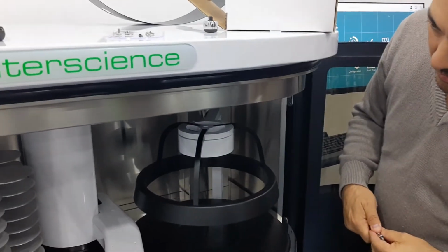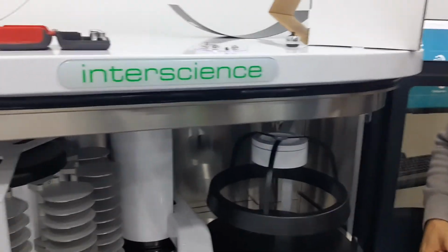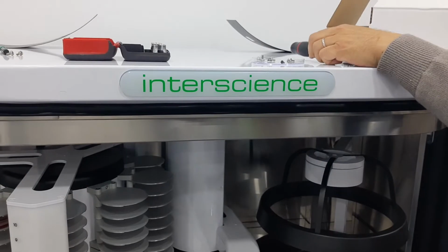Okay. I think we're done. So now we can put the front panel back. Yeah.